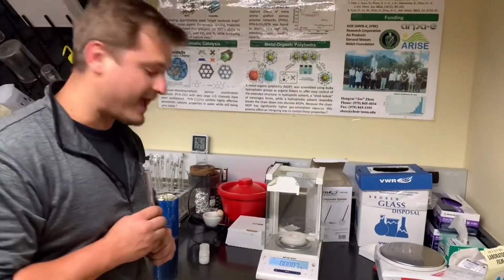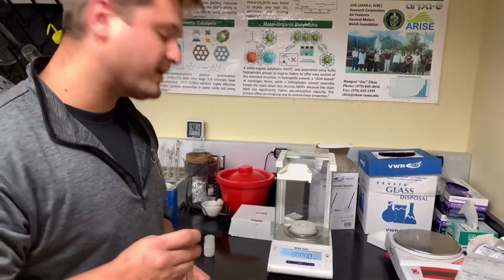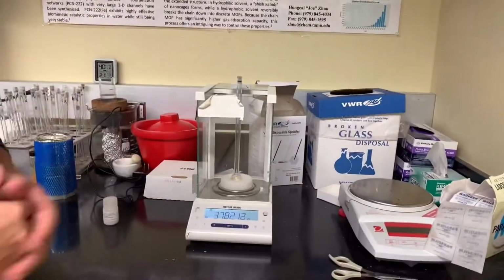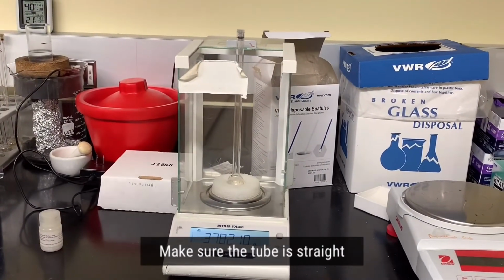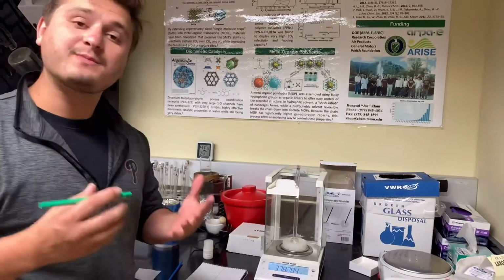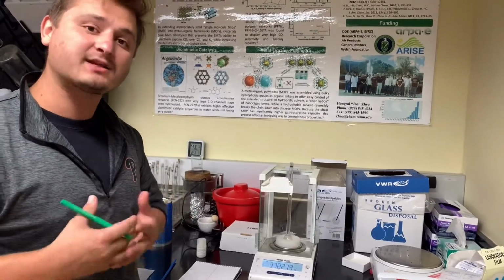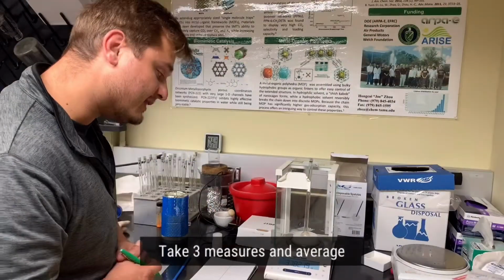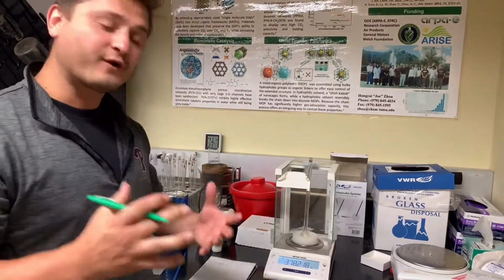When you come to the scale, you first want to zero the scale. Then you want to open the top, make sure it's reading 0.000, and then you want to put the sample tube on top of it, making sure that it is standing straight up and down and it is not leaning on any of the sides of the scale. Like I said, we really need to be accurate with the mass calculations, as all of these adsorptive data sets are per mass calculations with these instruments. And so we want to take 3 measurements each time. So we can see, we let it level off, and we can see 37.8219 grams. That is our first mass measurement.